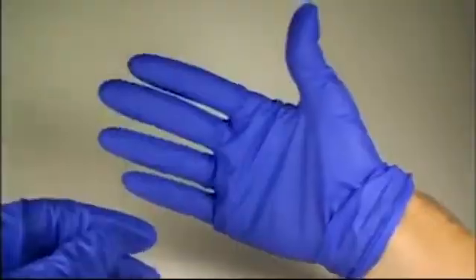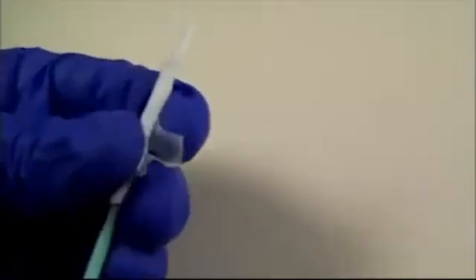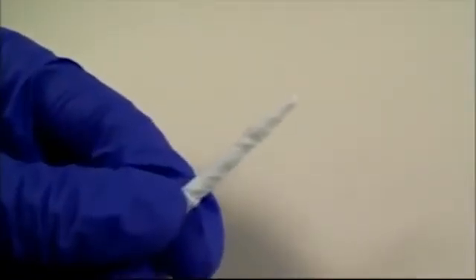At this point you should wash your hands with soap and water, or use appropriate lab gloves. Get a clean kim wipe and cut or fold it into a narrow strip. Then roll it part way around the spatula, fold down the edge over the spatula's tip, and finish rolling. You'll do this lots of times, using lots of fresh kim wipes each time you clean.